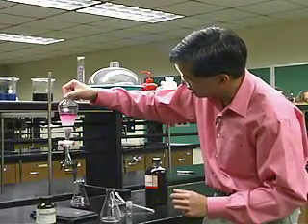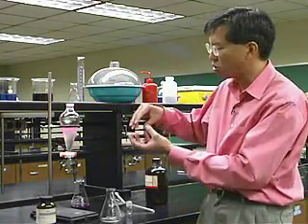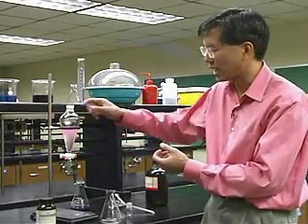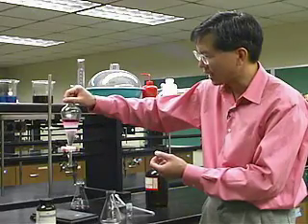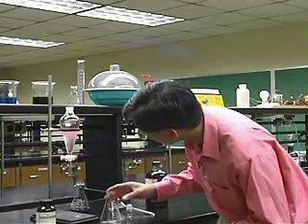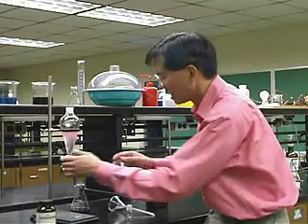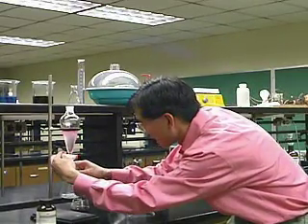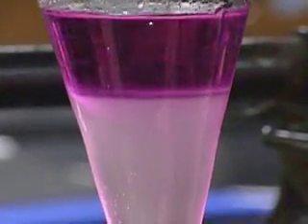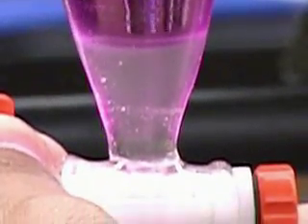Sometimes you have to wait a little bit for the two layers to separate — that requires patience. Sometimes you'll get an emulsion or foam at the interface between the organic layer and the water. In that case, add a little bit of sodium chloride — table salt — and it'll help break up that emulsion. The water is now considerably more colorless than before — it was a yellowish brown and now it's getting close to clear — and the hexane layer is colored because more iodine was extracted from the water into the hexane layer.